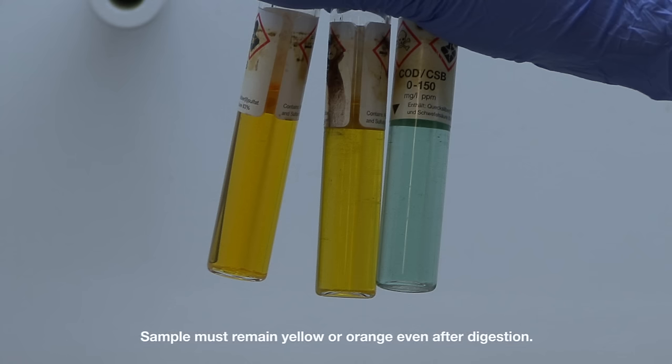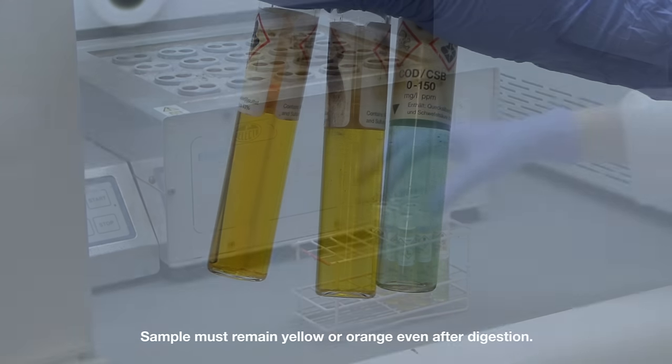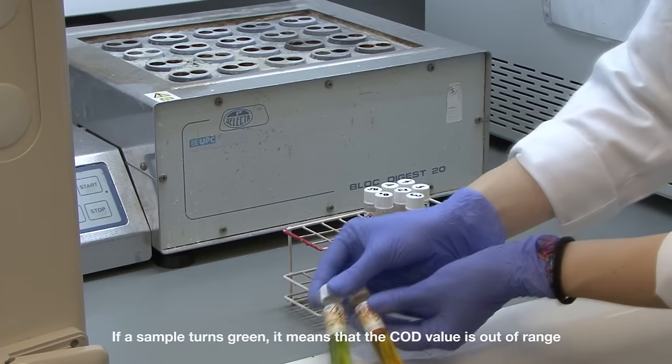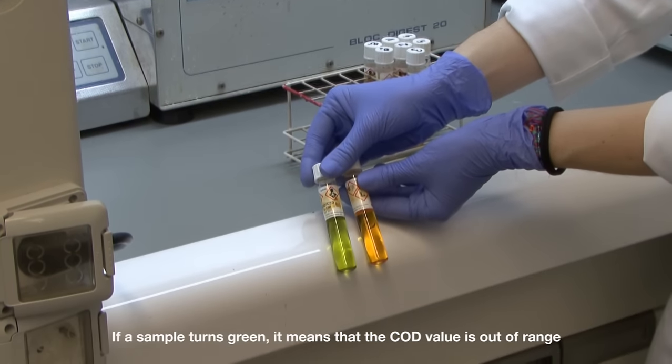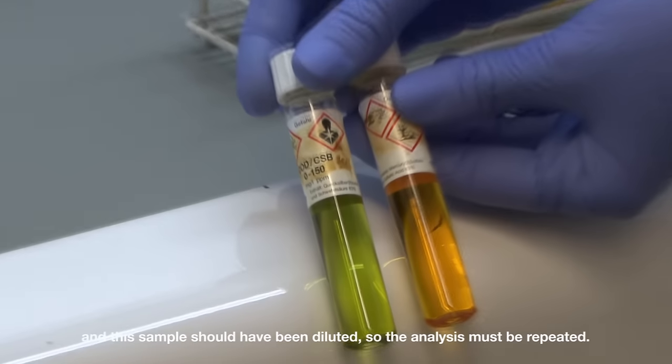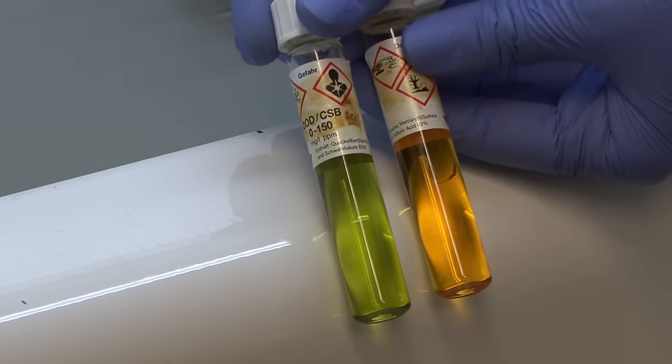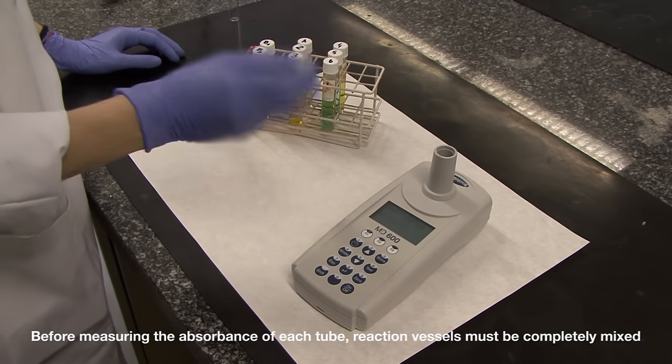Sample must remain yellow or orange, even after digestion. If a sample turns green, it means that the COD value is out of range, and this sample should have been diluted, so the analysis must be repeated.